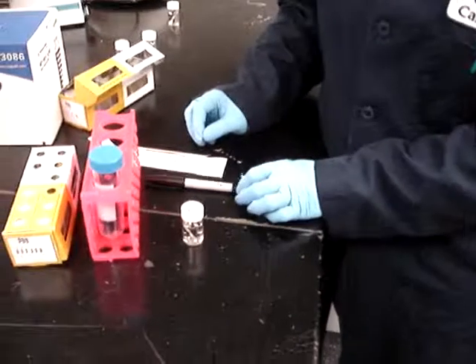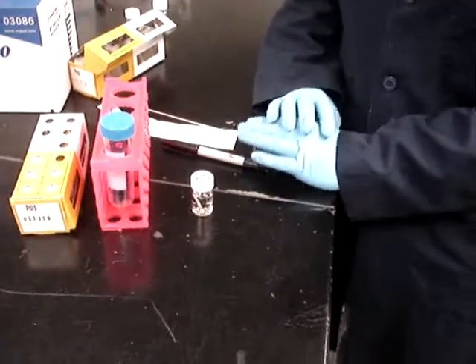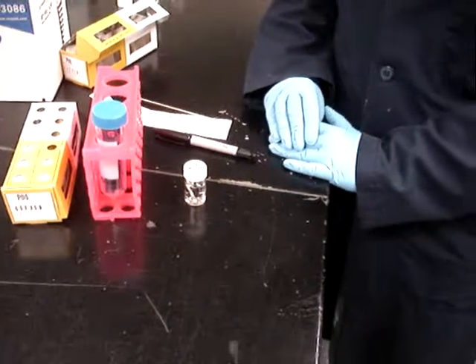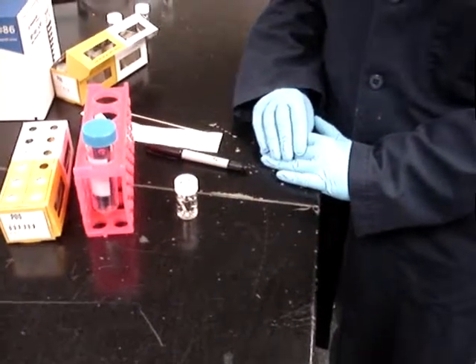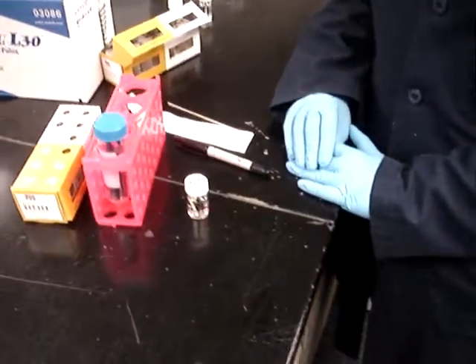The vial can be sent right now for analysis in the lab, or it can be held at room temperature, but better to be refrigerated for days or weeks before it's sent to the lab for analysis.